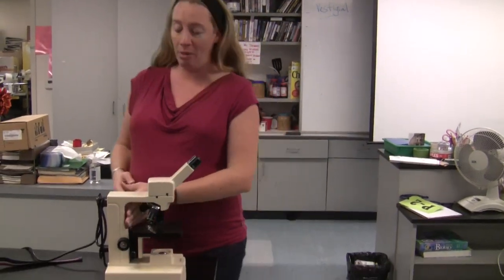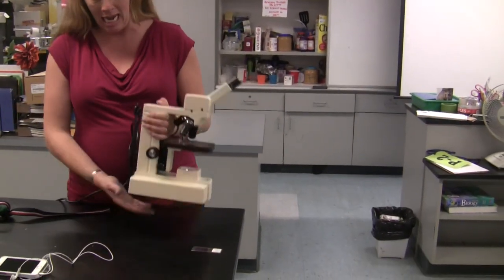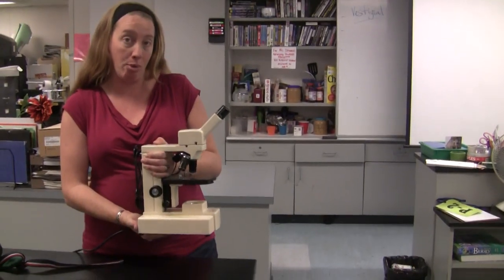So we have the lovely microscope, which to carry it properly, you need to carry it by both the arm and the base. Make sure you have your hands on both.